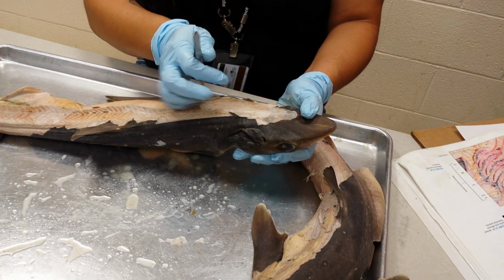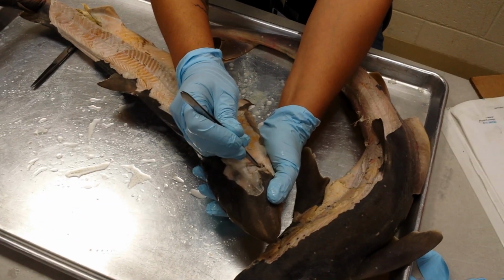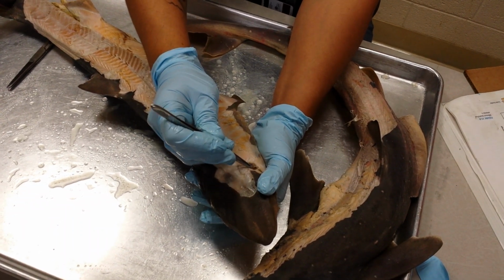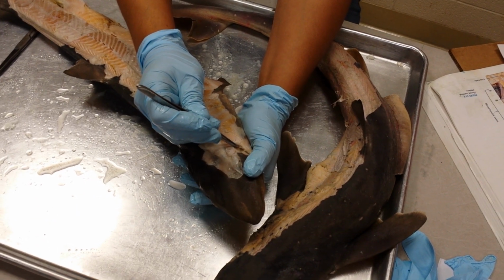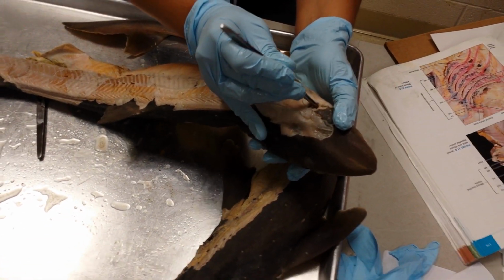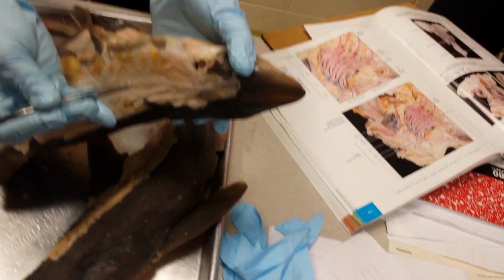You have this spiracle here, and the spiracle has a wall. This wall is actually a wall of muscle, and the muscle is called the spiracularis. It helps close the flap of the spiracle. If we look at where the wall of the spiracularis meets the body, it's way down deep in there. You're going to have to look for yourself.